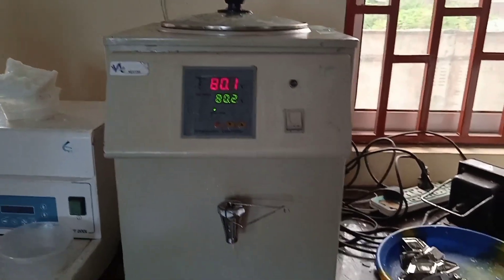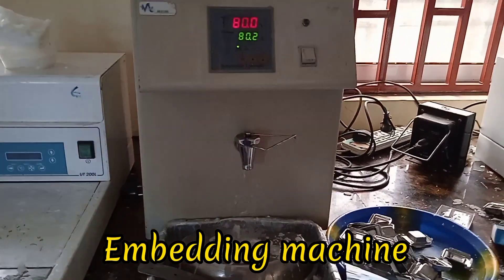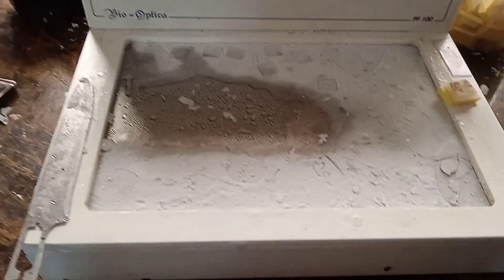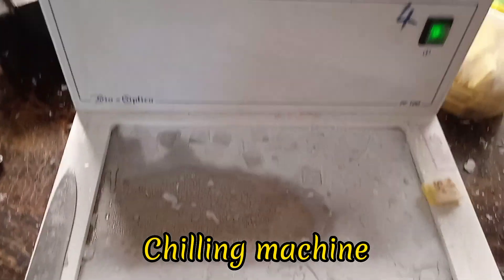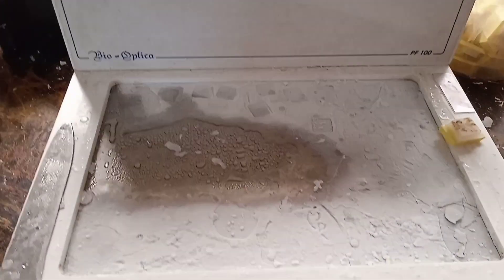I just arrived at the histopathology lab and these are some of the equipment that we use here. This is the embedding machine — it is used to embed the tissue in a molten wax. And this is the chilling chamber, the chilling machine, that is used to solidify that tissue.